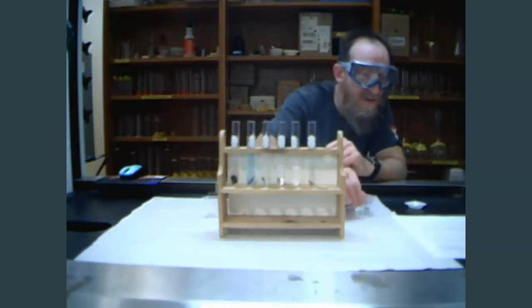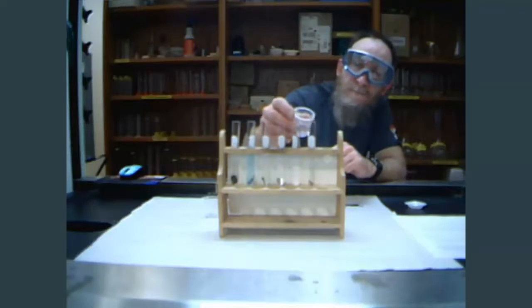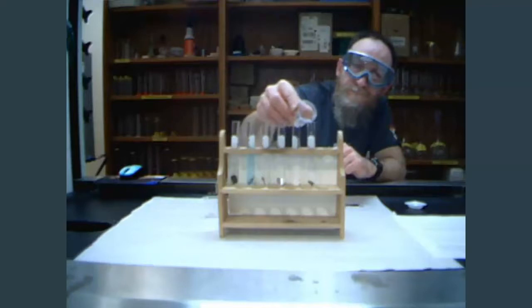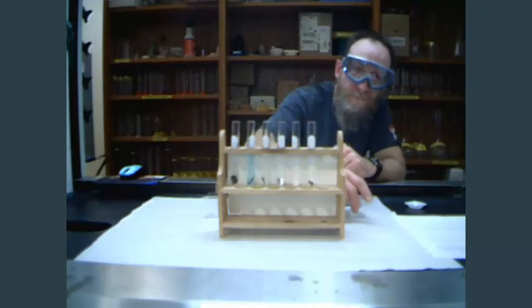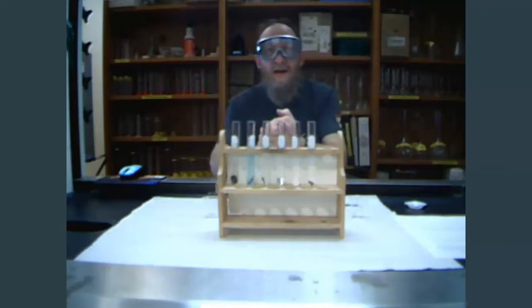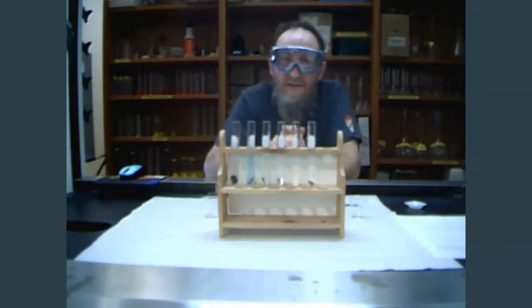And finally, some sulfuric acid to the zinc. Now, I've put a white background on there to try to make it so you can see it a little bit better. But I will move the camera closer, we can see.